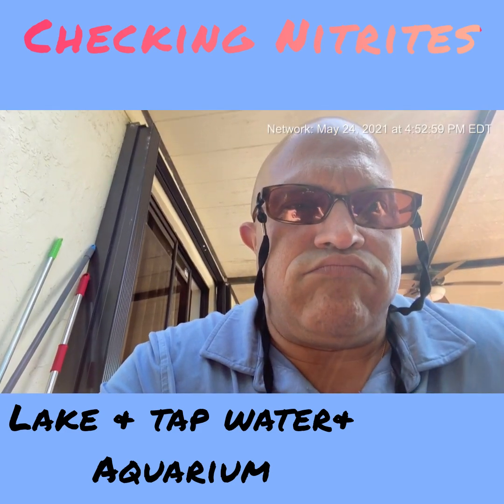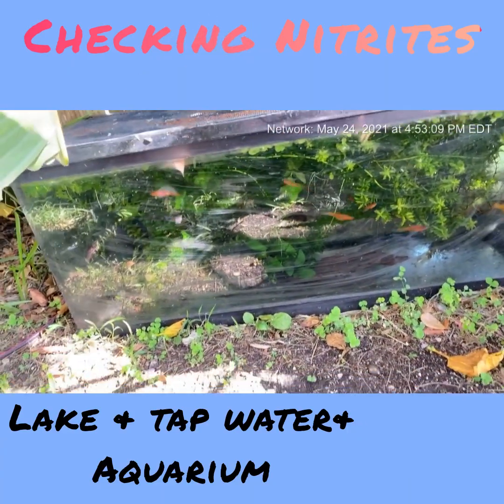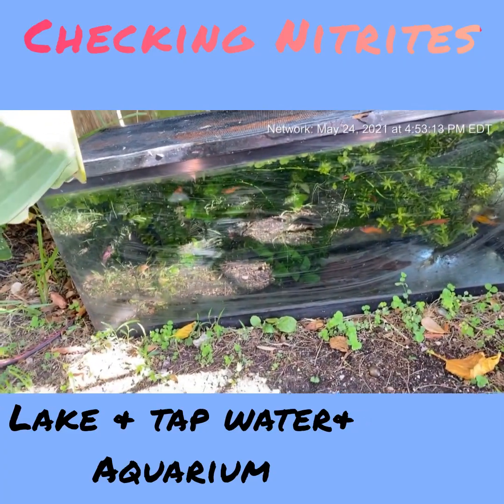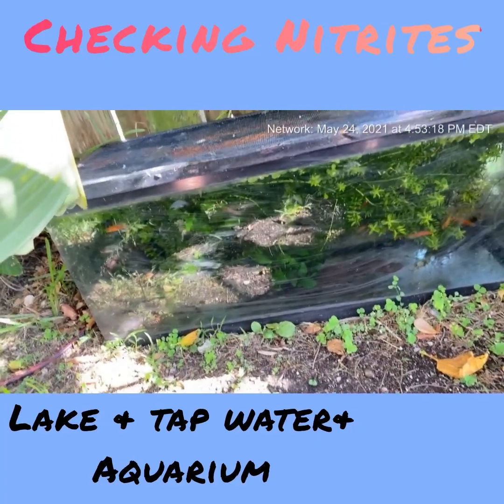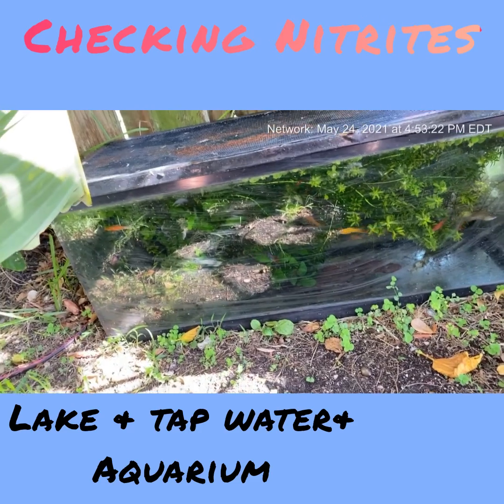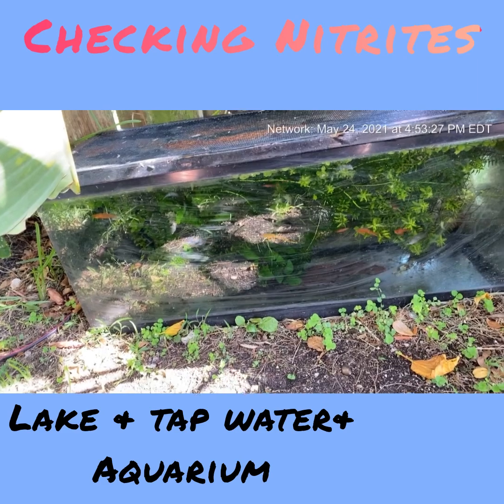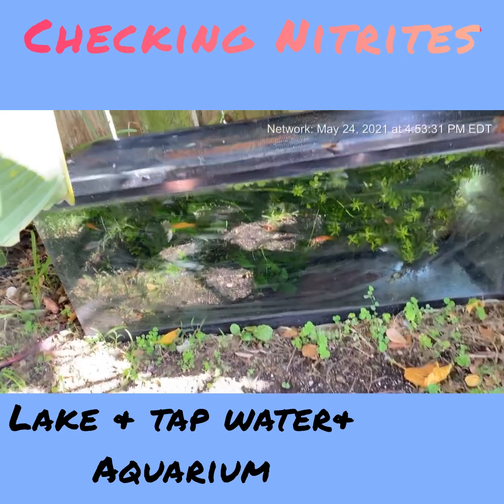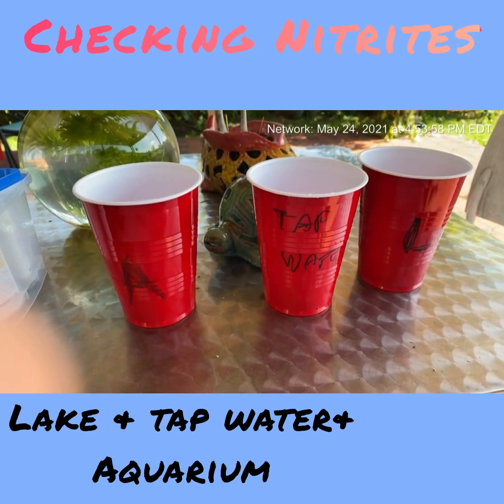Here's the tank I was talking about. I think this is my best tank — the other ones are great but this one is solid gold. Let's see how we do with nitrites in this tank. Like I said, I've never tested nitrites in my life, so this will be a good test.